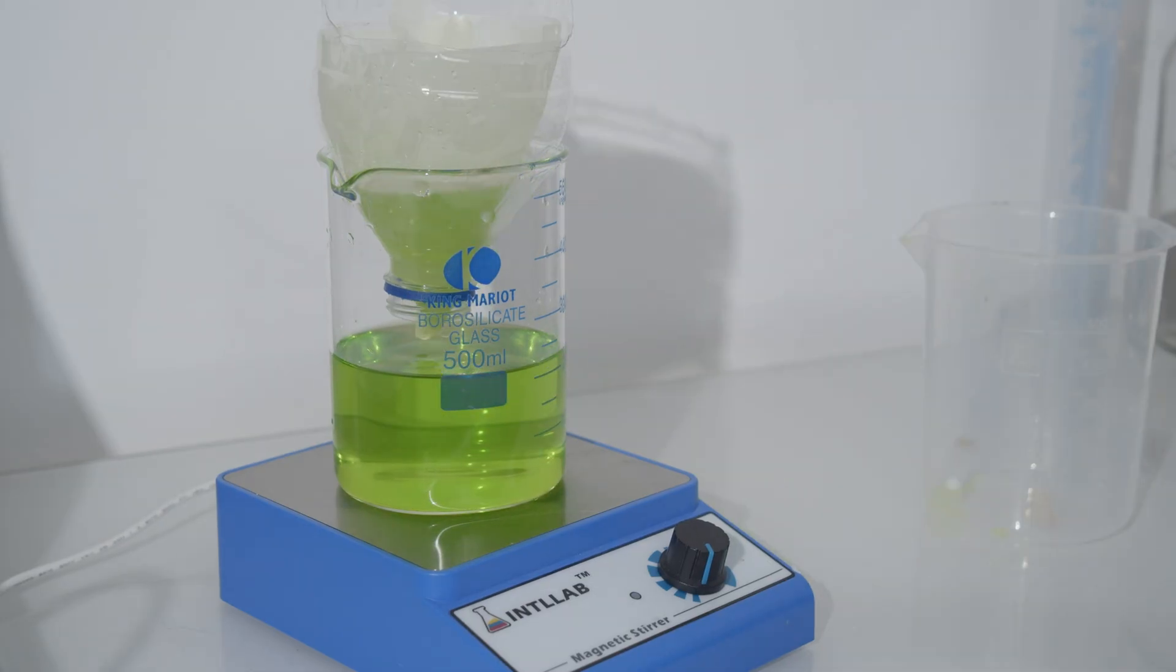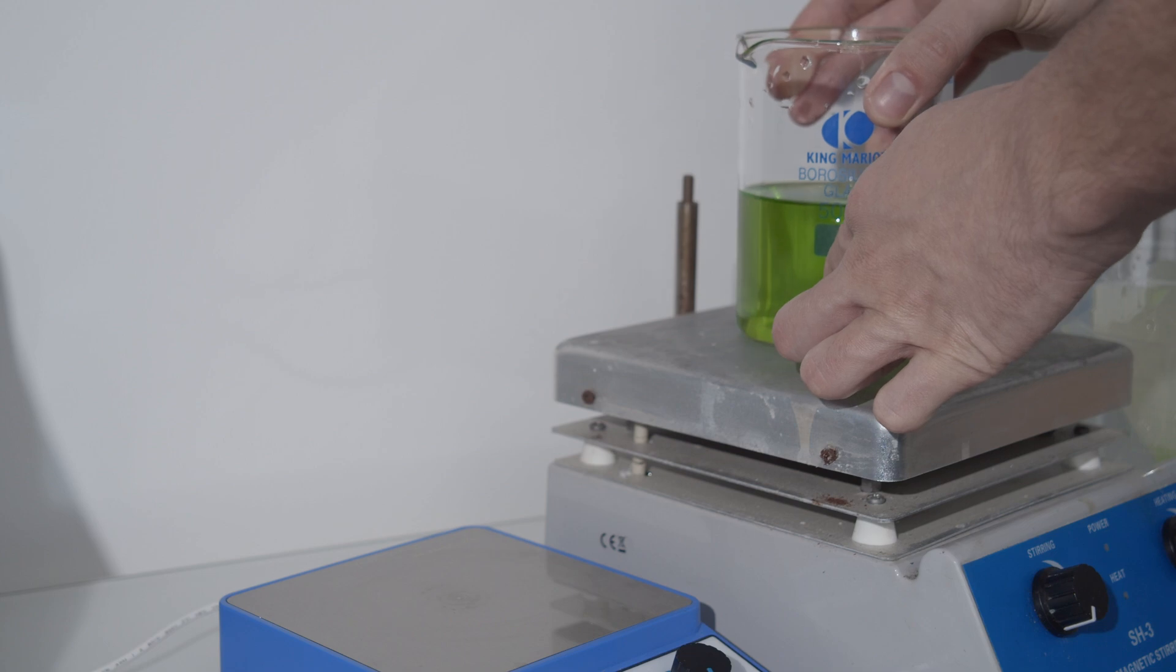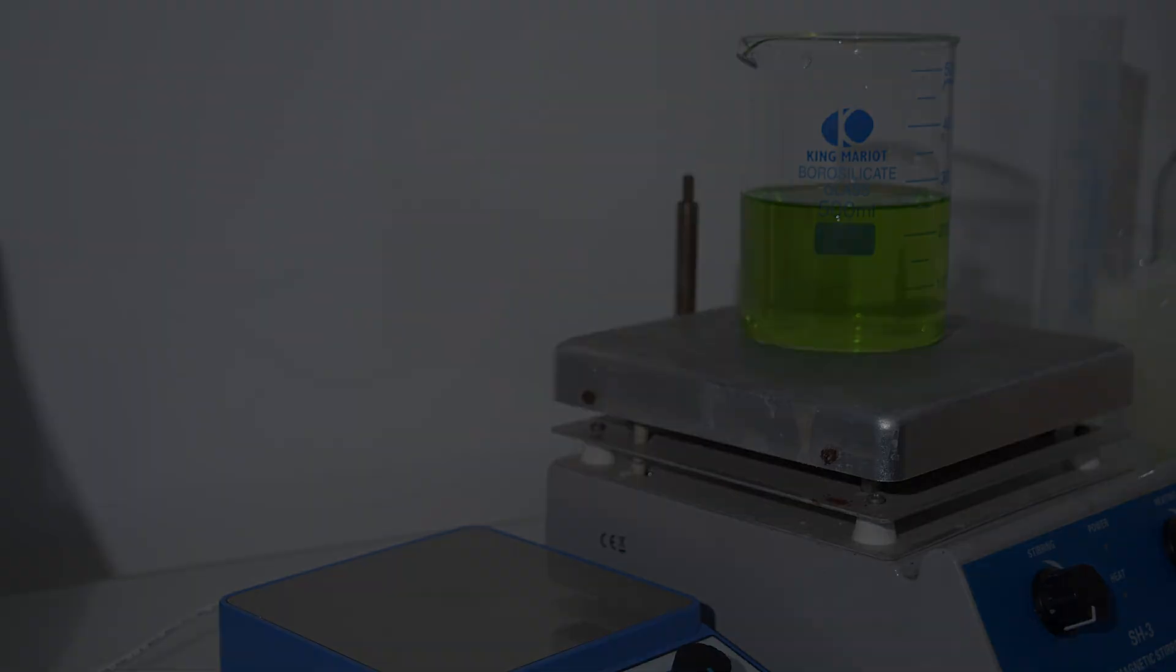I filter the solution and gently boil it on a hot plate, down from 250 milliliters to about 100.